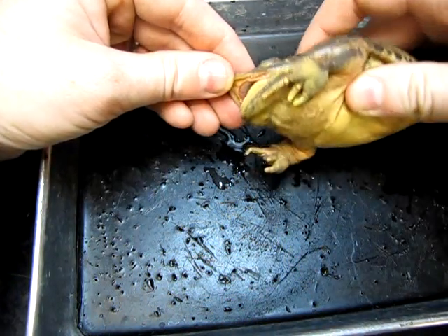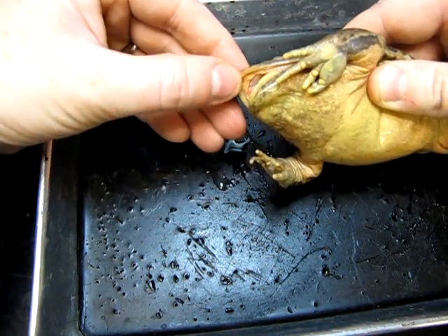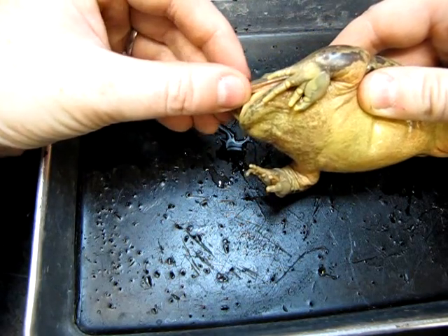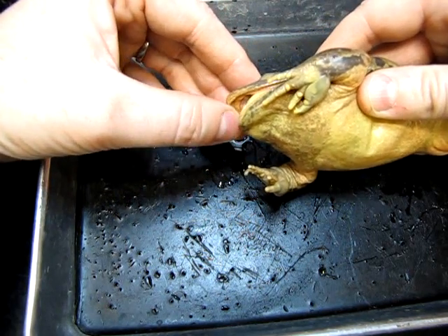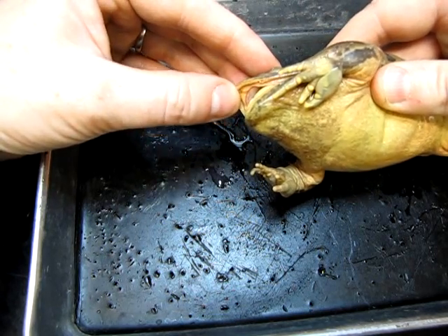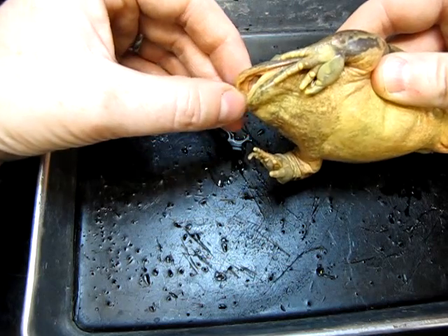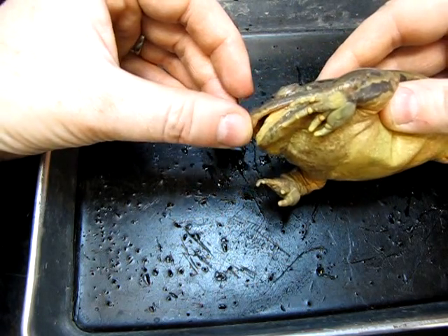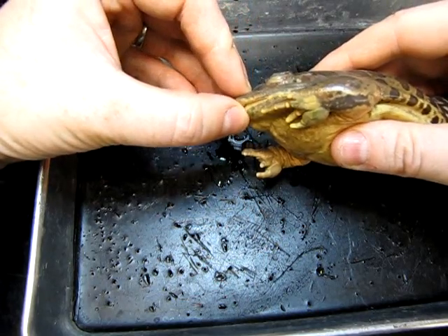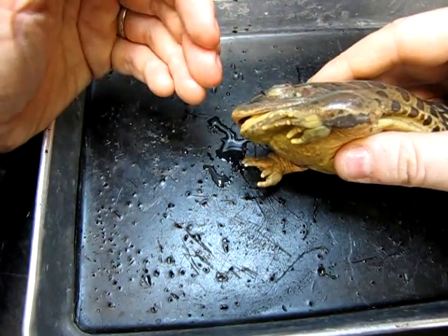Another thing that we don't often think about is the fact that frogs do have teeth — they're very small. If you were to run your finger along the inside edge of this upper mandible here, you would be able to feel the maxillary teeth. These are the maxillary teeth up here. Although they aren't used for chewing, they are used to keep the prey in place and hold it in the mouth before it's swallowed and consumed.